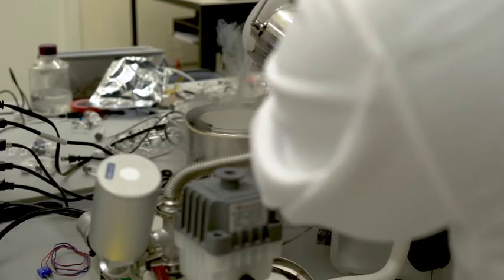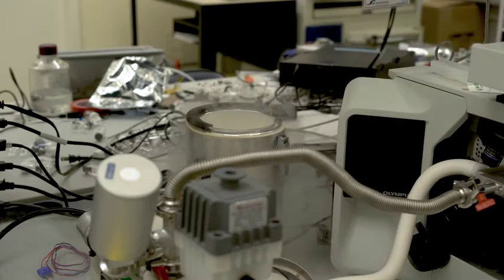Proper PPE, safety glasses, and cryogenic gloves must be used at all times.